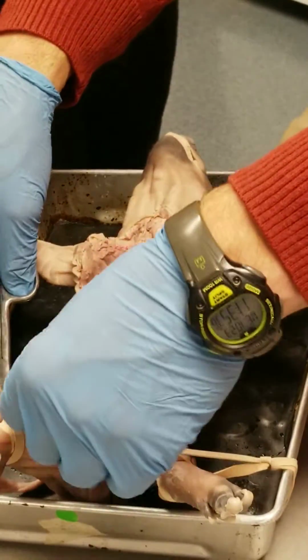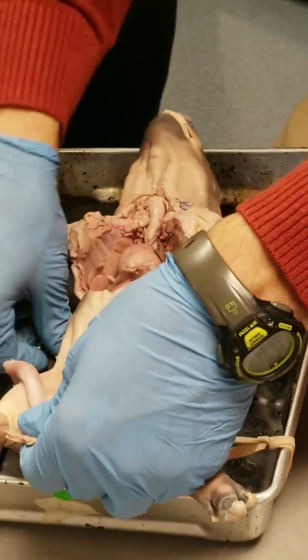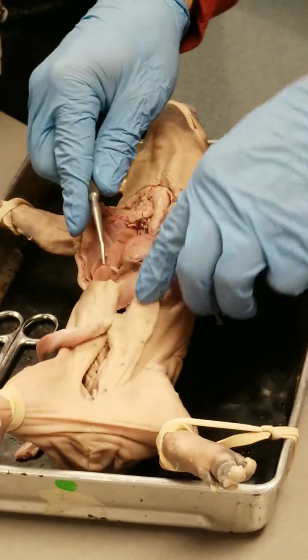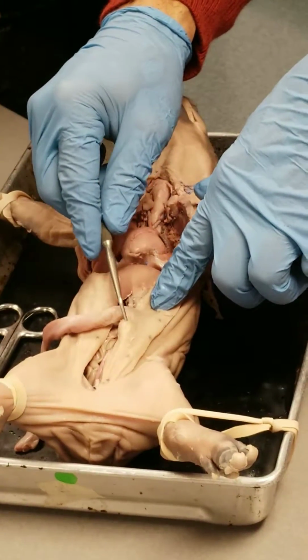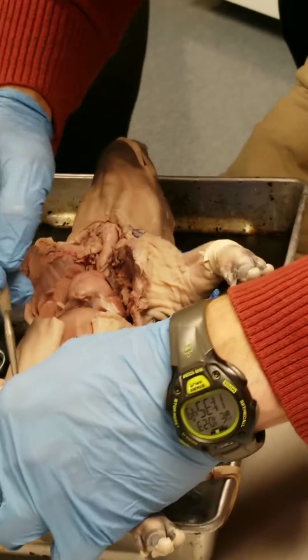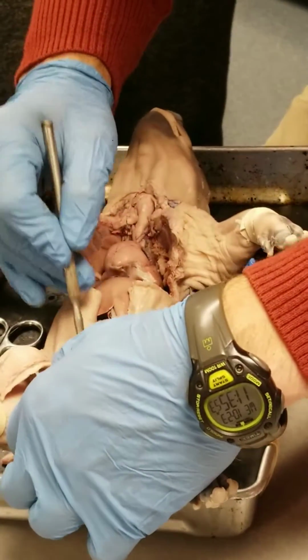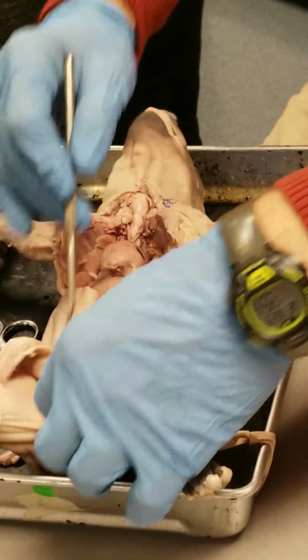Cutting it off? No, I'm not. No, this is a male. Yeah, it is a male. Urogenital opening right here. That's right. So yeah, it's there, but it takes a little work back here to reveal that, and I'll save that surprise for another day. It's here in the wall.